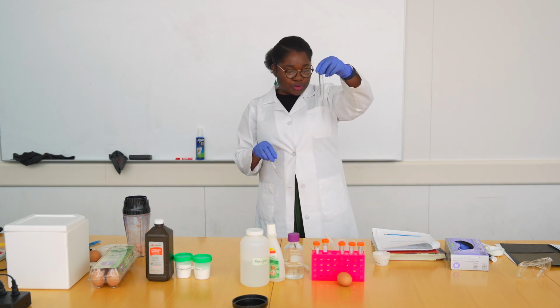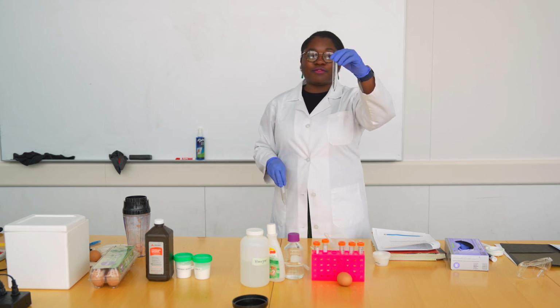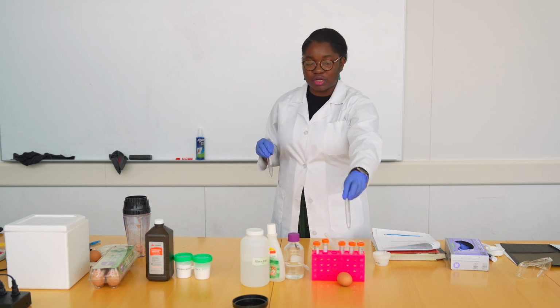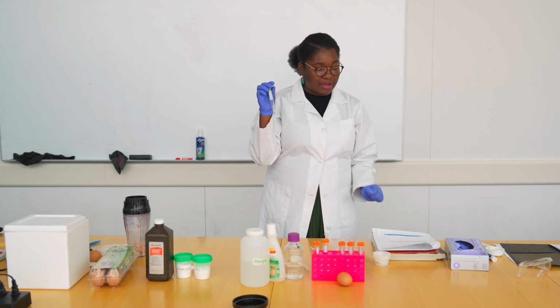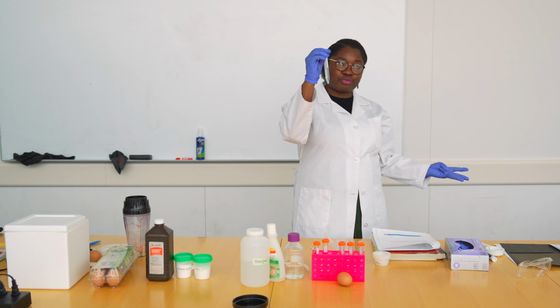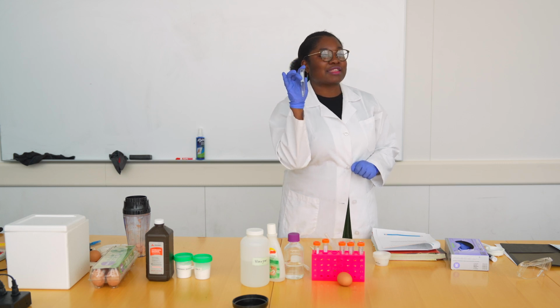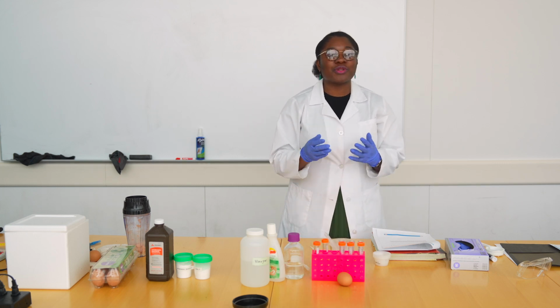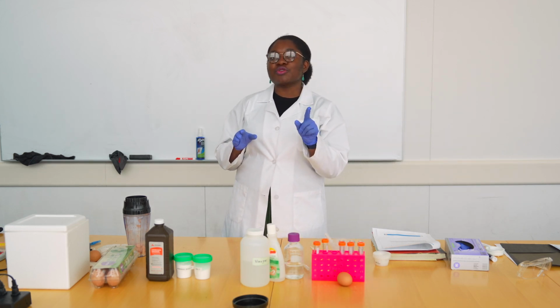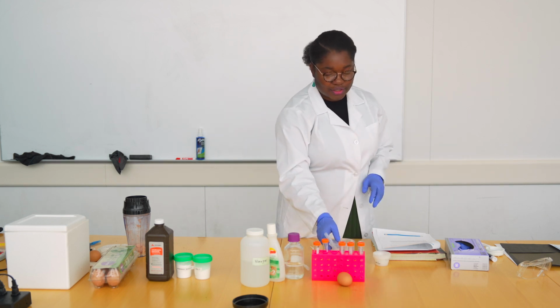We have our second tube, which is going to be our control catalase, testing what happens if we don't have vinegar in the solution, which is a little bit like what we saw earlier. And then in our third tube, we have another control, which is the water control. This control only has water, vinegar, and hydrogen peroxide, and no potato juice, so we are not expecting any enzymatic activity in it. This is how we could assess whether vinegar is doing anything. Is it reacting with the enzyme in the potato juice, or is it reacting with the hydrogen peroxide? We are going to test all of that. So let's get started.